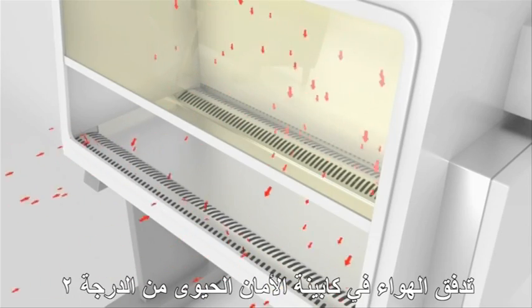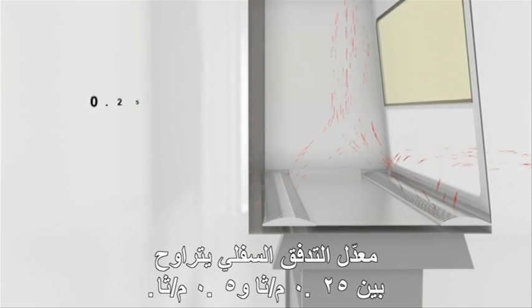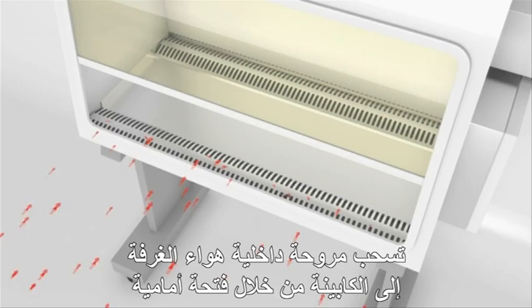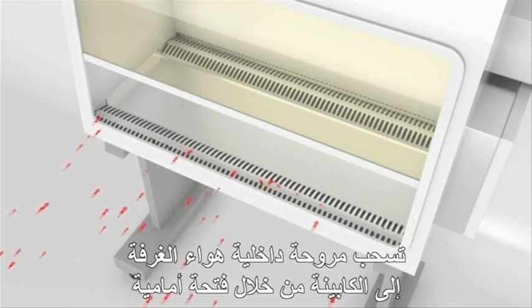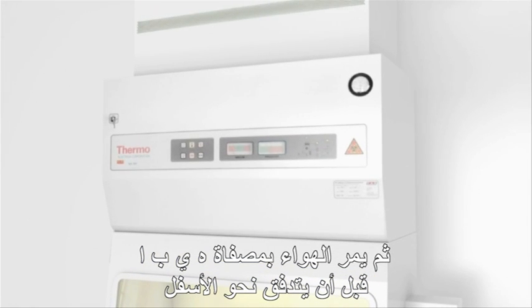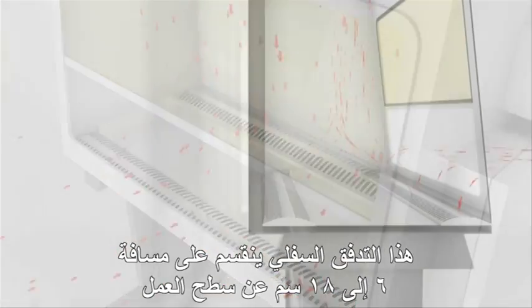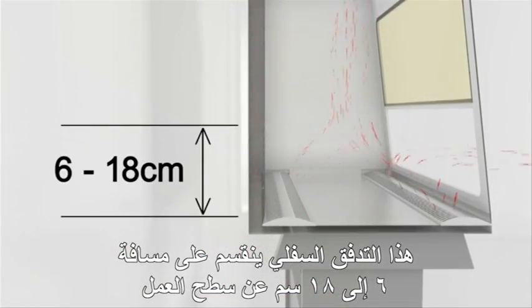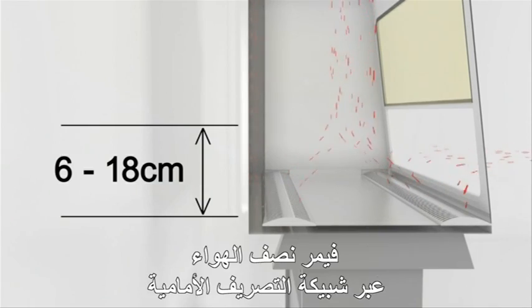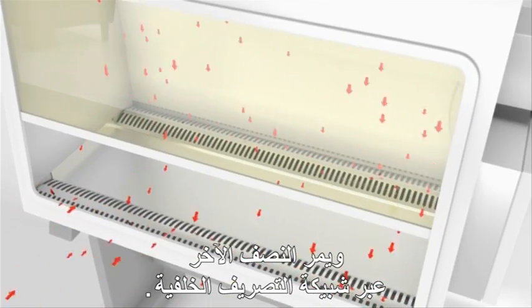Air flow in a class 2 microbiological safety cabinet is measured as downflow. This downflow rate should be between 0.25 metres per second and 0.5 metres per second. An internal fan draws room air into the cabinet through the front opening and into the front intake grille. The air then passes through a HEPA filter before flowing downwards over the work surface. This downward flow splits about 6 to 18 centimetres from the work surface, with one half of the air passing through the front exhaust grille and the other half passing through the rear exhaust grille.